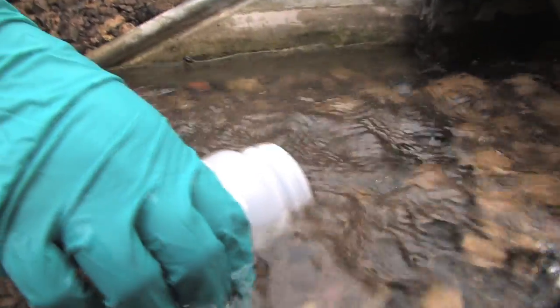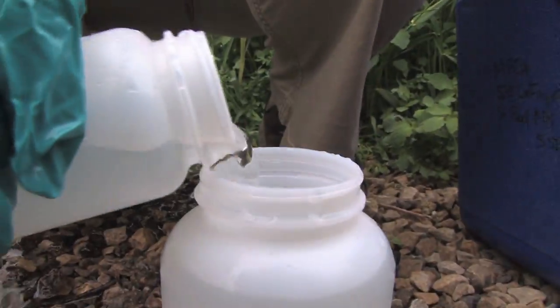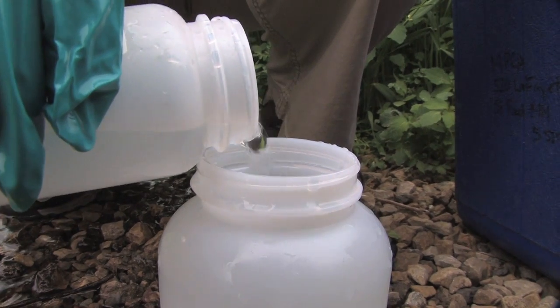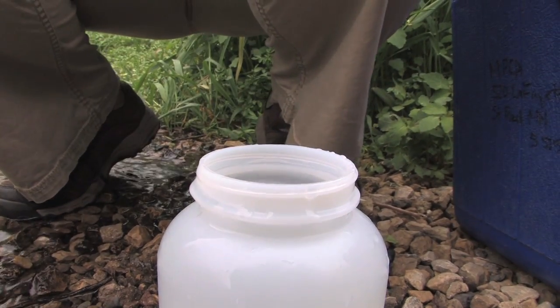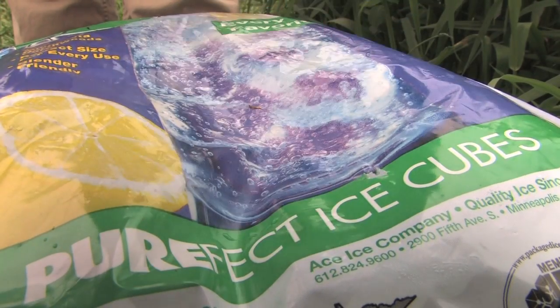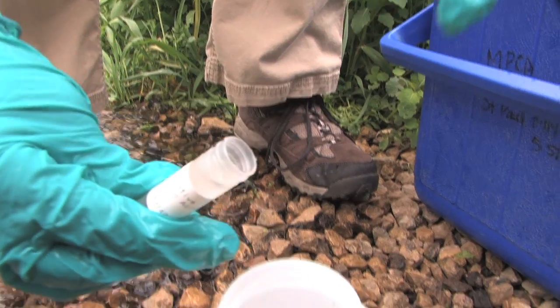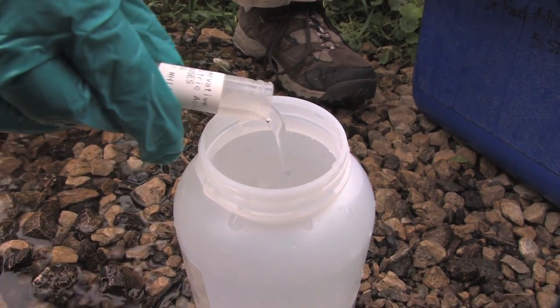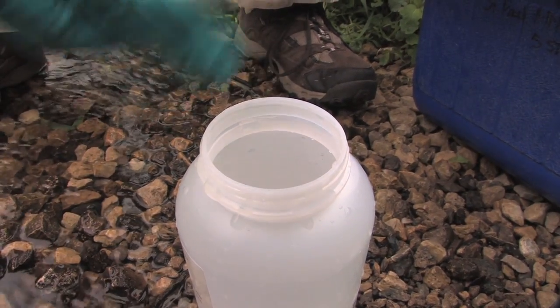Your lab should have instructed you how full the bottle should be — fill it to the level they instructed. If the sample bottles came with preservatives, add them now. Be careful not to spill, as preservatives are most often acids.